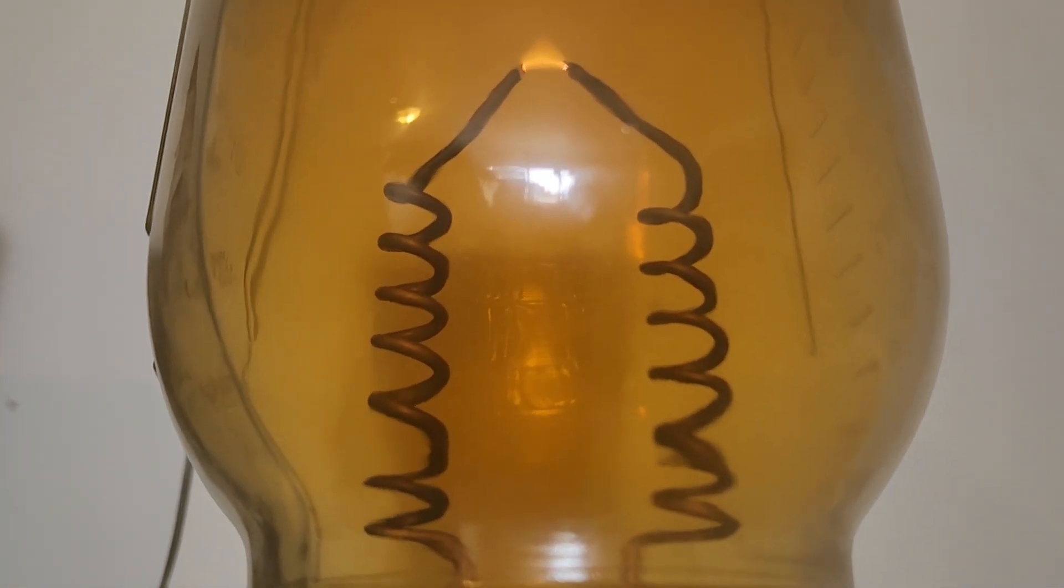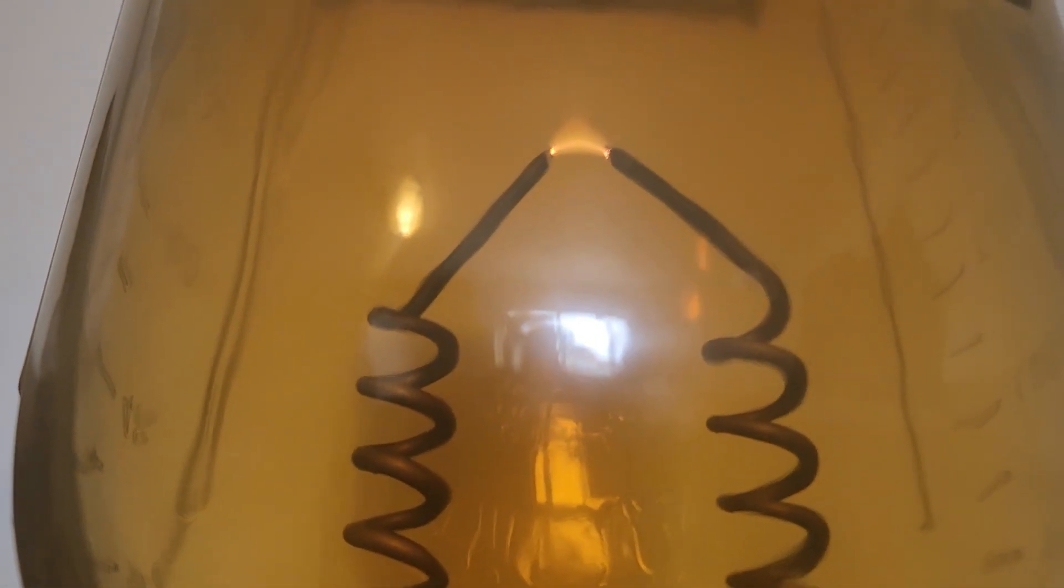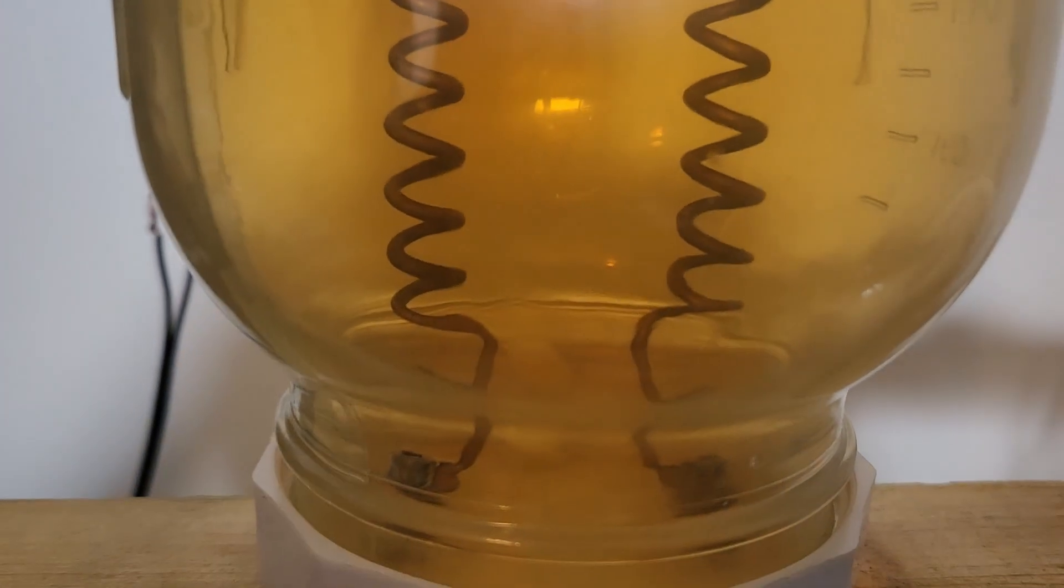Heat is dissipated and prevented from reaching the lower hardware, adding to the overall safety of the generator. At the top of the copper rods, a simple and stable arc is formed, producing just as much nitrogen dioxide as the Jacob's ladder method.